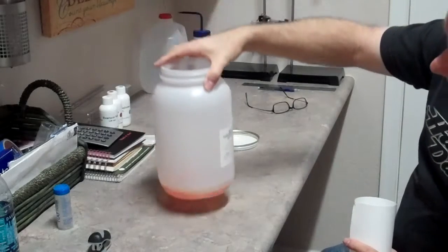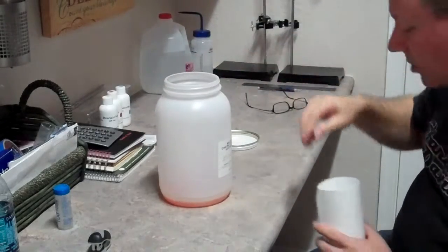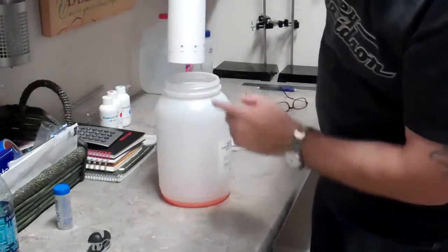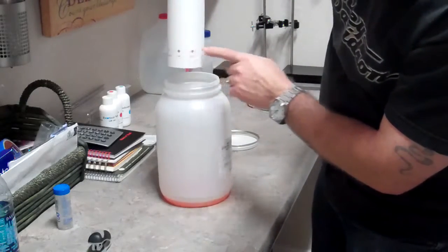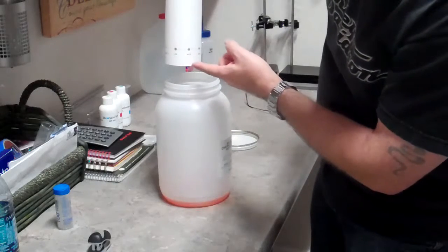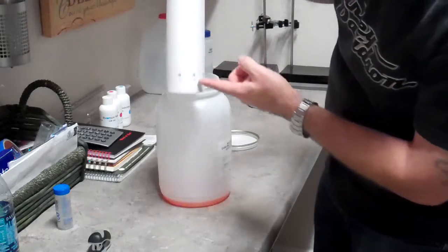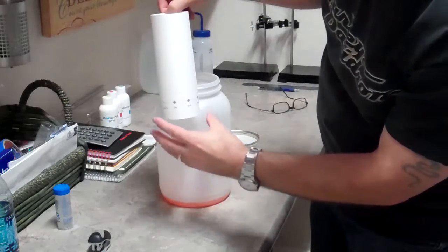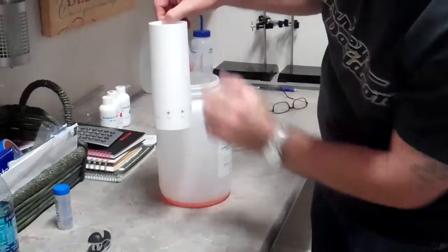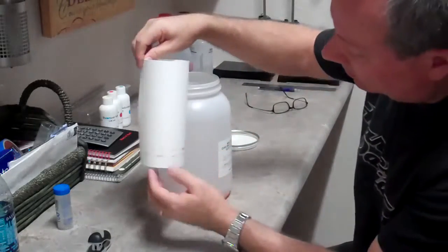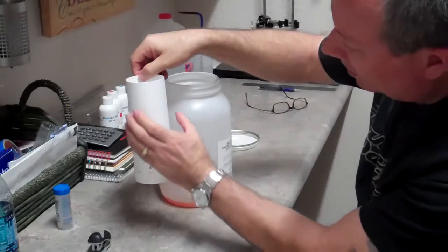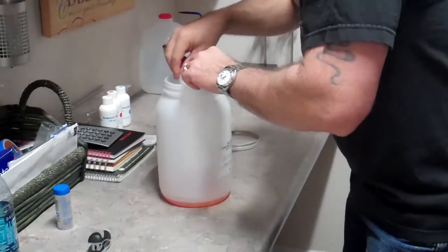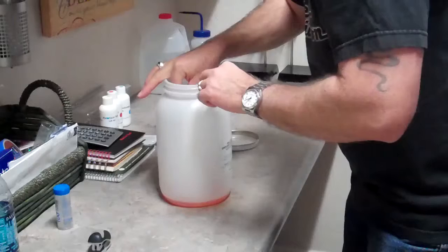We poured about half an inch of solvent into the bottom of this container. We're going to take this and very gently set it down in there, making sure our samples are on the lower side. The solvent's going to wick up into the paper, and as it's wicking up the paper, it's actually grabbing these acids and drawing them up to different levels in the paper.